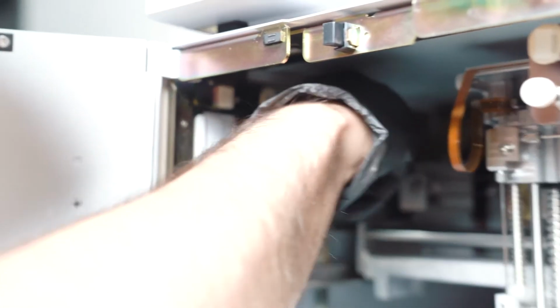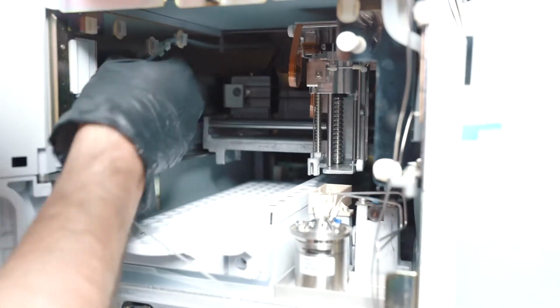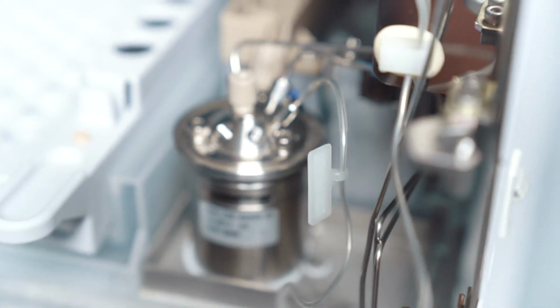Okay, that's good. And then you want to put the clips back. So again, 4 clips. 1, 2, 3, and 4. And you can test the motion by pushing the door back and forth to make sure it's going where it needs to go. Okay, and then you want to fish this one over here, and fish this one here. And then this loop goes into position number 1. Okay. Into position number 1. And you want to make sure that there's enough give, so you can always readjust the tubing as needed.